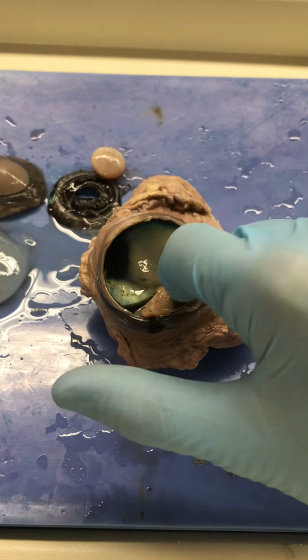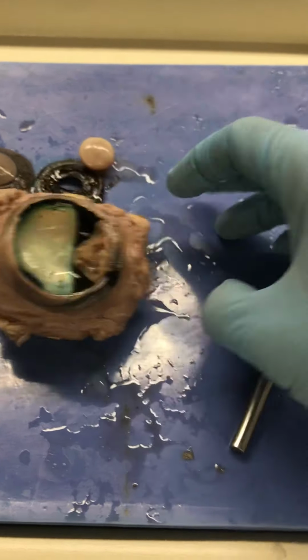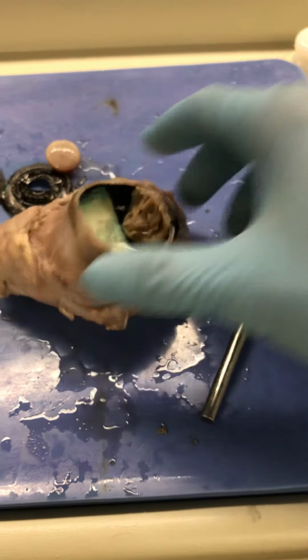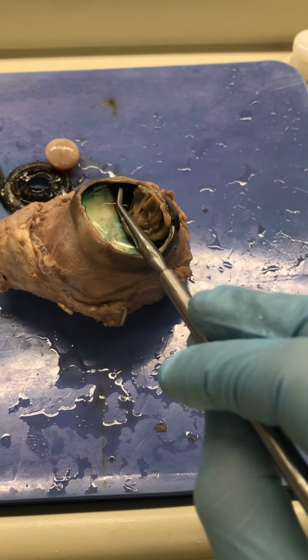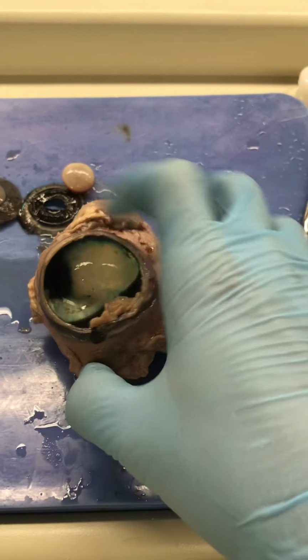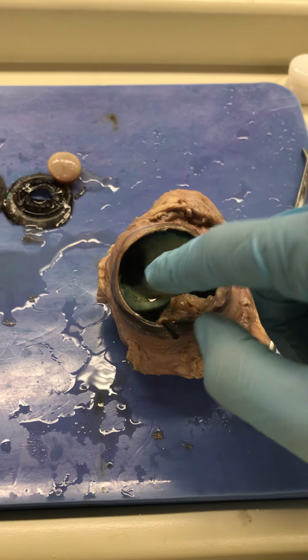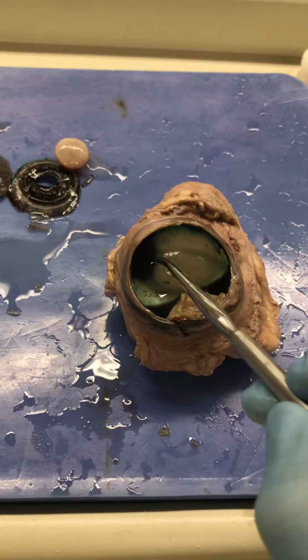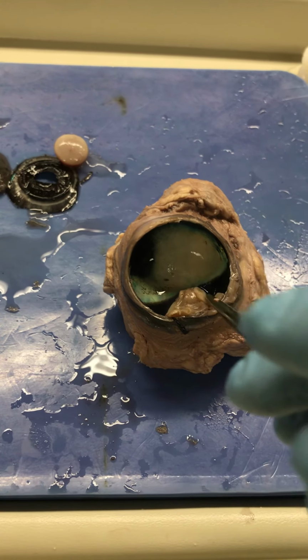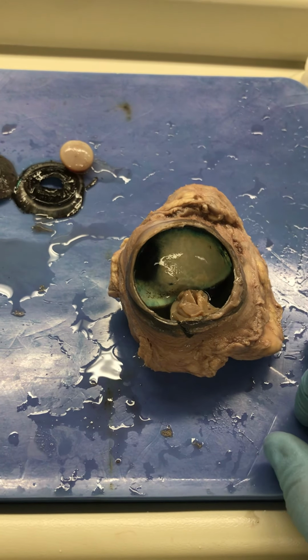Now, cows might not be able to see color like humans, but cows have something humans don't have. Cows have a tapetum lucidum, which is a reflective structure that sits on what we call the choroid. Now, we have the choroid, which is a vascular structure that nourishes the retina and the eyeball. But our choroid is just this black color, and it will reflect red from the vascular tissue, and that's why sometimes we have that red light reflection in pictures for humans.